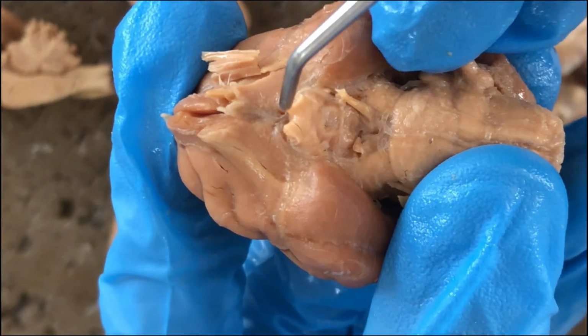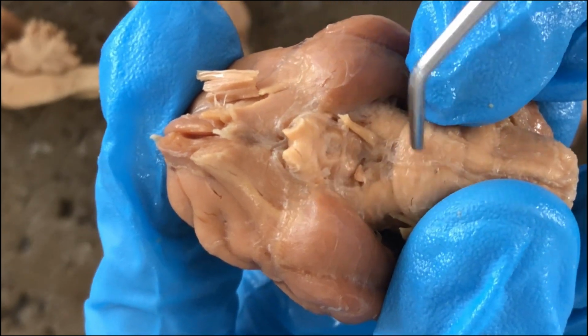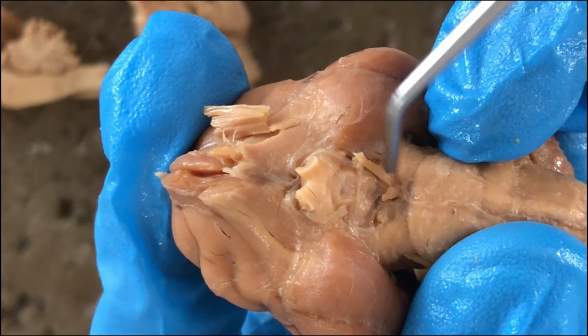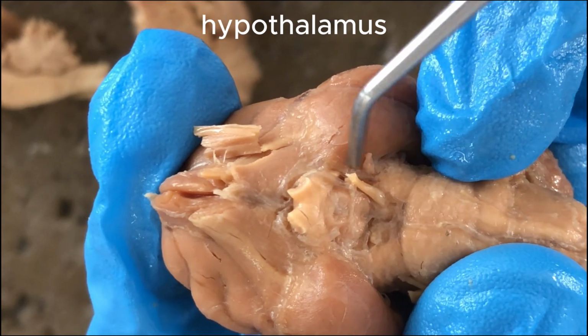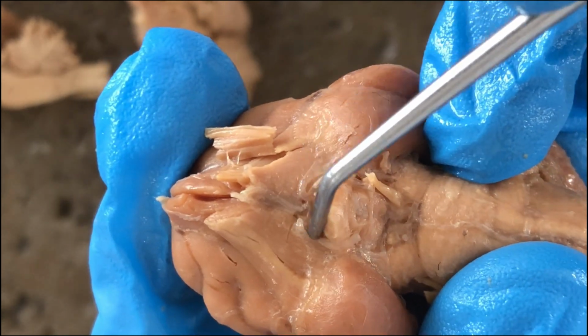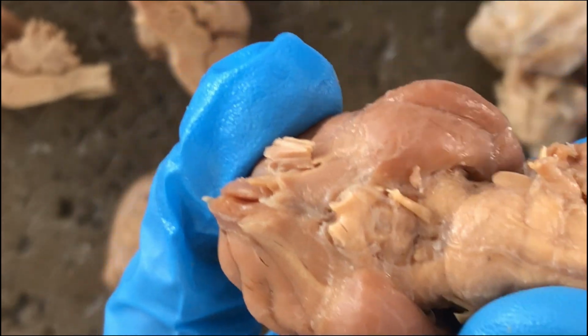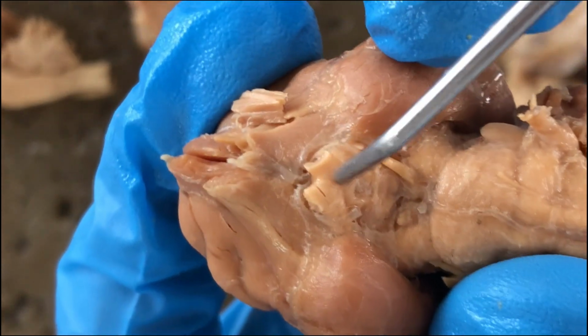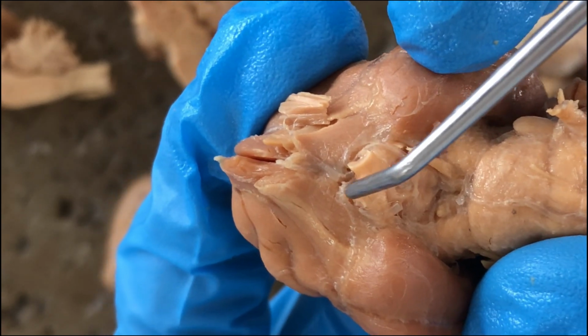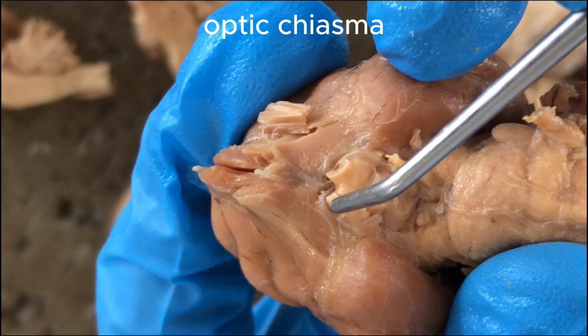And next, if you move more posteriorly, you'll see part of the hypothalamus. So this region here would correspond to the hypothalamus, which has many subparts. This X-like structure is the optic chiasma.